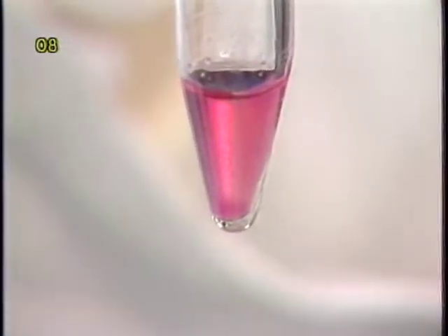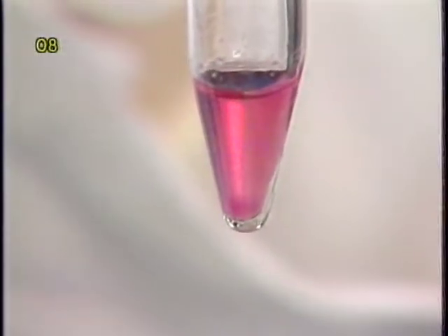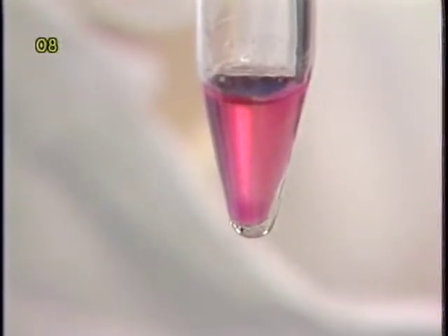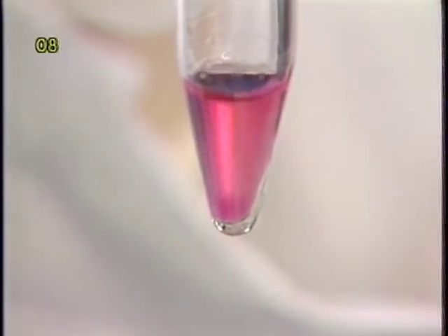Before the addition of the nuclei counting solution, the culture supernatant must be removed. Microcarriers settle to the bottom of the tube quickly, even without centrifugation.